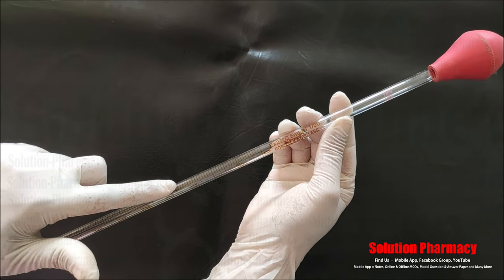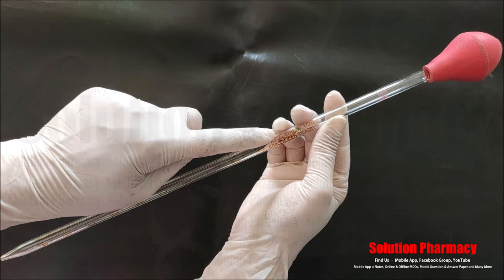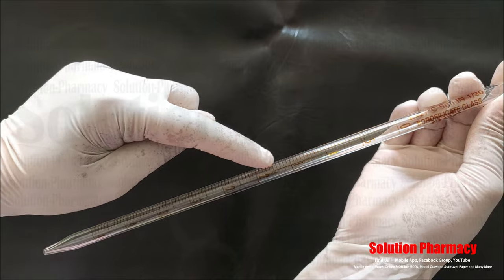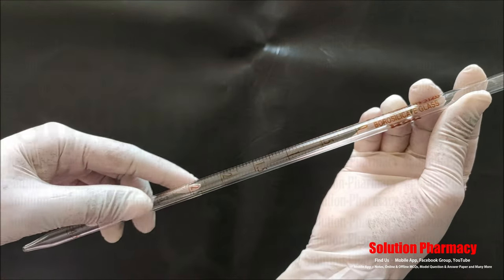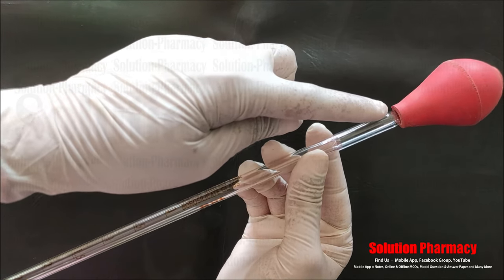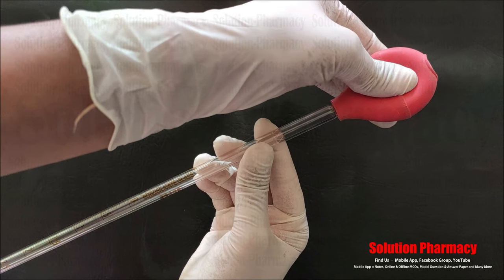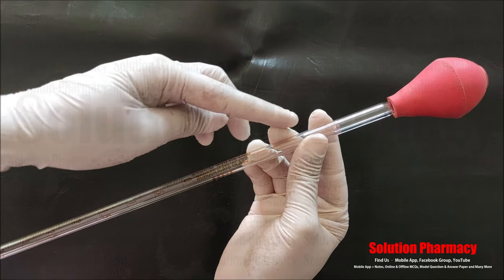Next, this glassware is called a graduated pipette. This pipette is made of borosilicate glass — this is a 5 ml pipette. You can see different markings and divisions; according to these divisions we measure the required volume very precisely. Also visible here is the pipette bulb, which is made of rubber. We press this rubber bulb to create a vacuum, dip the pipette into the liquid, and then slowly release the bulb so the liquid fills the pipette up to the required volume.